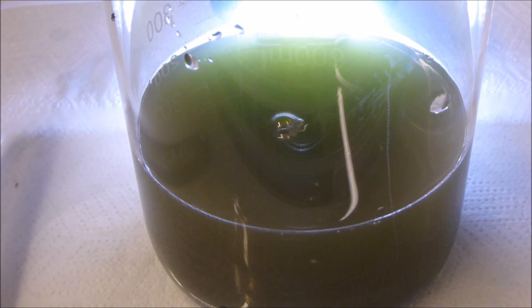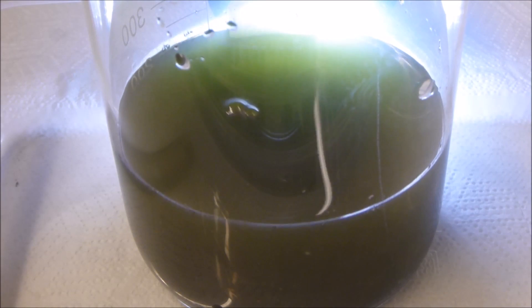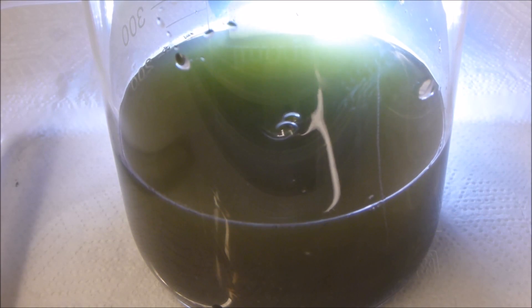And that's pretty much it for the precipitation. I can already see a little bit of gold floating at the top there, and I would guess that the gold in this is going to drop relatively quickly seeing as it's quite concentrated. It was obviously green because there's a little bit of copper in there with the gold. Hope you guys enjoyed this little video and good luck and be safe.